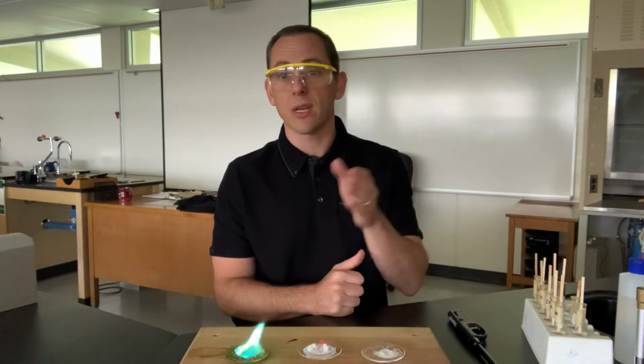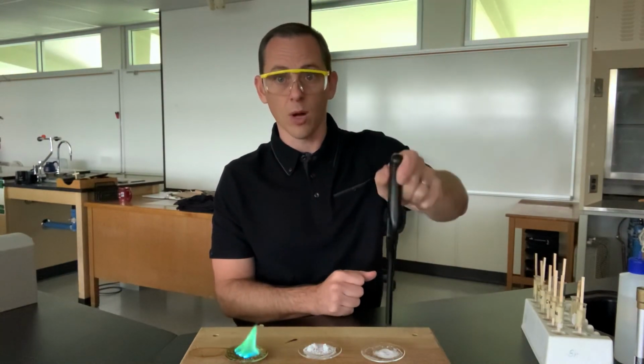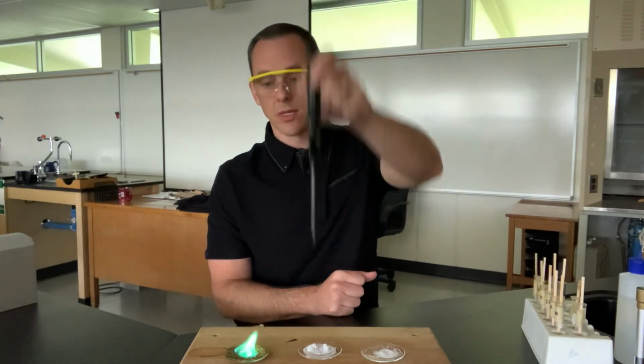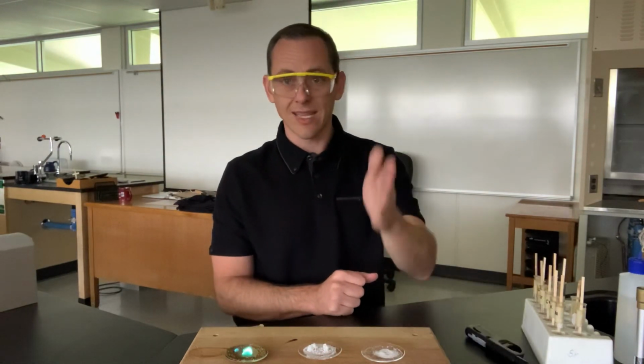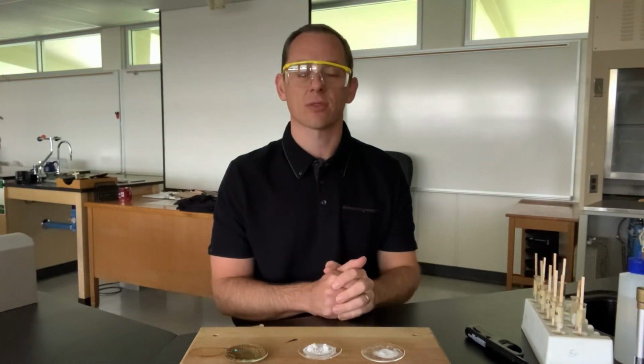What were the 3 unknown chemicals? So we'll say that this is unknown number 1. This one is unknown number 2, and then this sort of green one is unknown number 3. Okay, so what is the identity of each of these? And then there will be a few conclusion questions for you guys to answer as well.